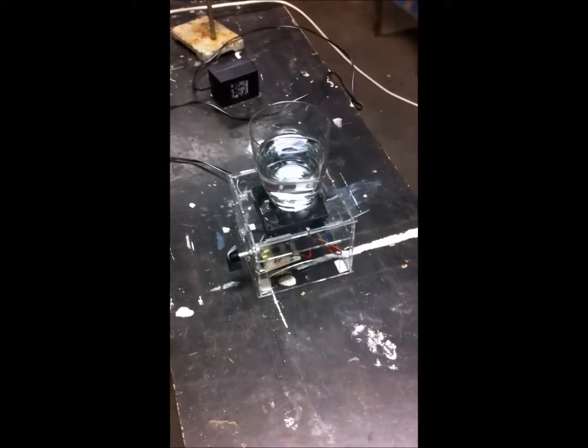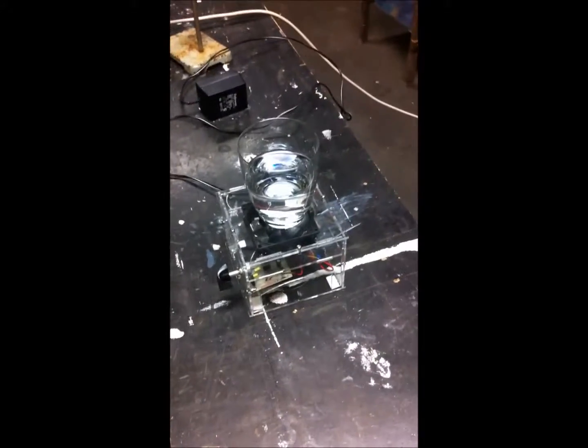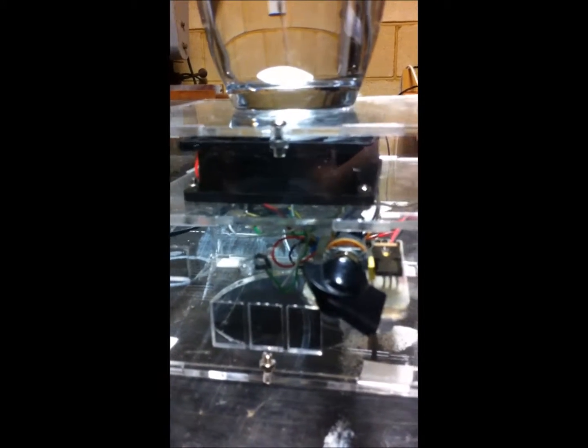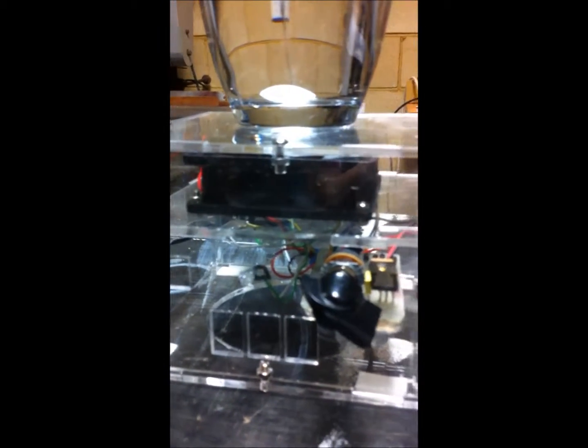This magnetic stirrer was featured and designed by Peter van Bohemen from the Biohack Academy. This is it made in acrylic. Just to give you a quick overlook over it, you can see this is the nicely laser cut box. I've used acrylic, the original was MDF.